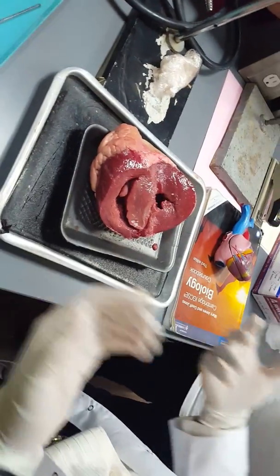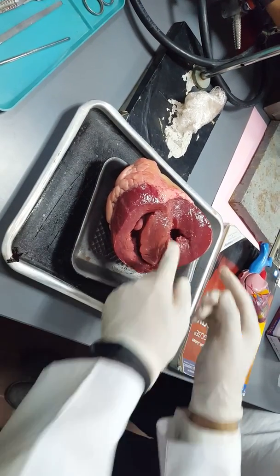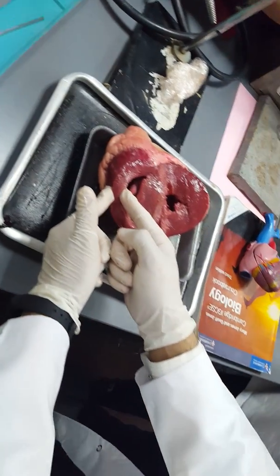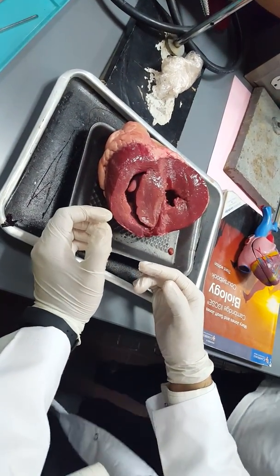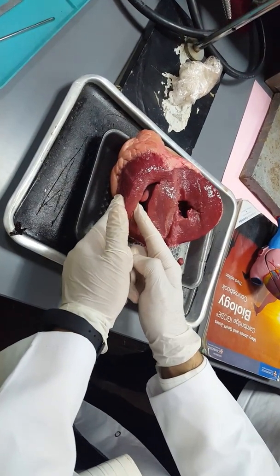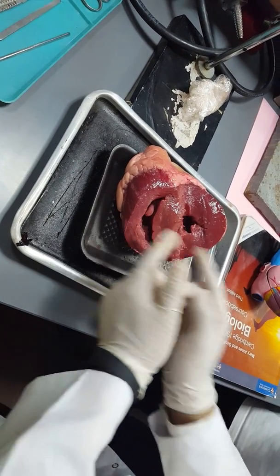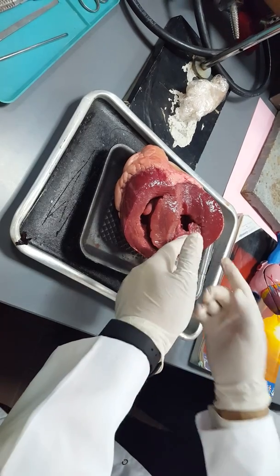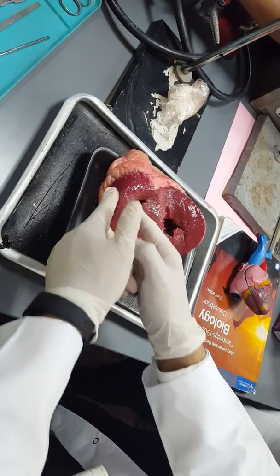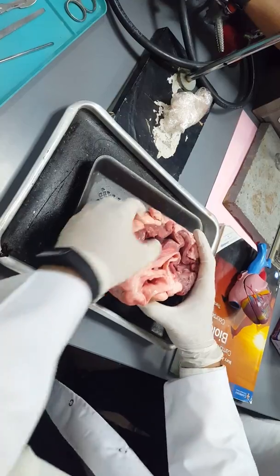And from this I can ask a question: why is the wall of the left ventricle very distinguished? It's thicker than the wall of the right ventricle. Okay, Hassan. Because the left side pumps the blood all over the body, while the right pumps just to the lung. Only one organ, and the distance is shorter than the distance to all the body. That's why the wall of the left ventricle is much thicker than the wall of the right ventricle. Very important notation also.